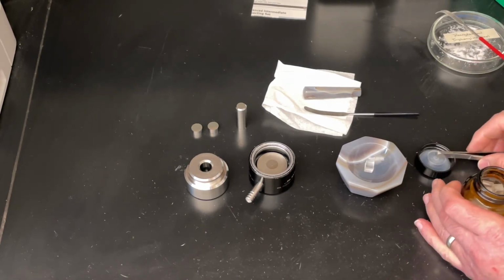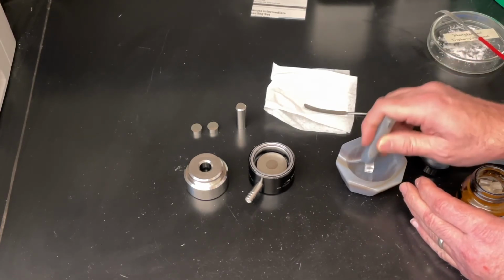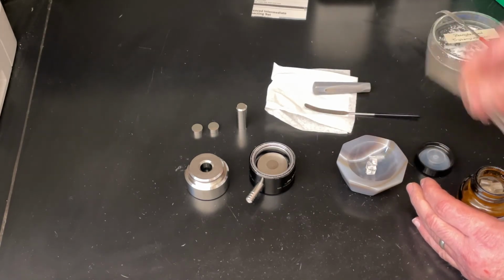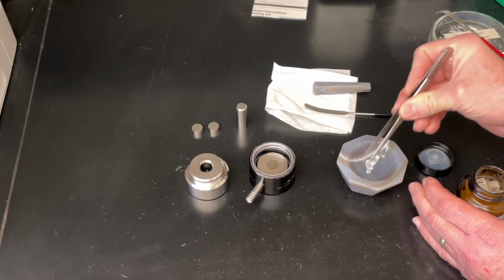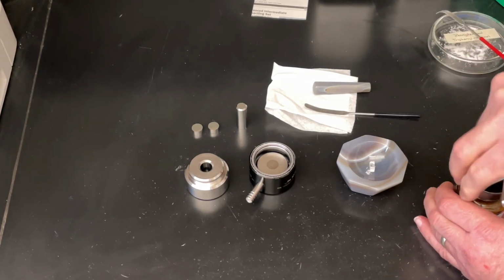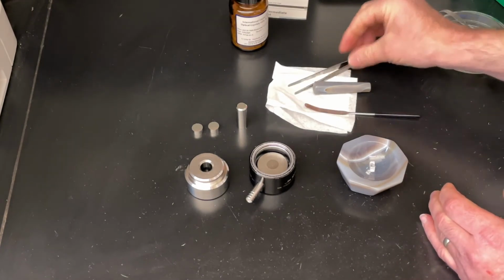What we're going to do is take one of these larger crystals. We're going to give it a couple of whacks in order to fragment it into a few pieces. The pieces that we are not going to use, we will put back. I think that ought to be enough. We're going to take that material and grind it up until it is like talcum powder.